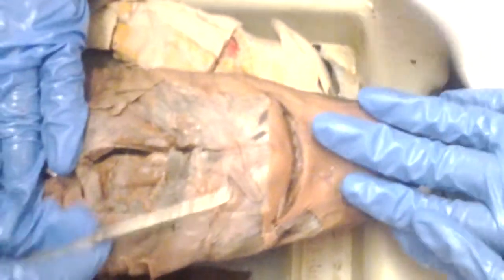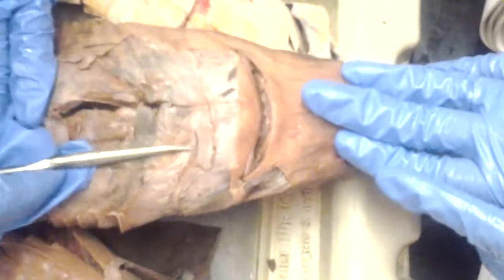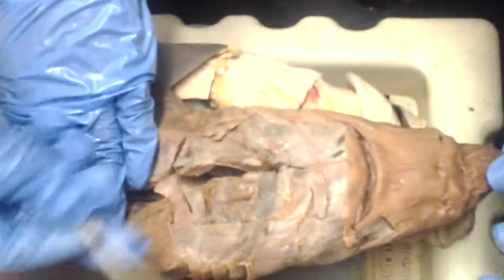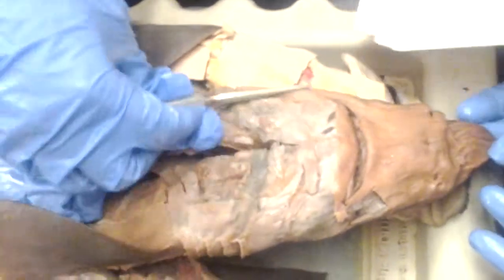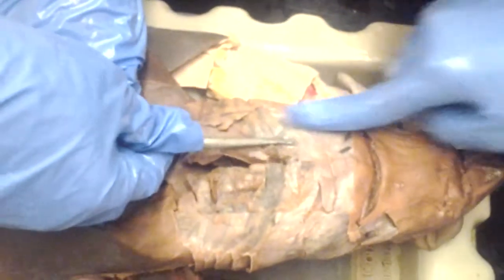Intermandibularis is going to be the outermost layer, the first layer you come to when you dissect. So it connects between... We took it out. Where does it originate? The mid-ventral raphe. And it goes to Meckel's cartilage. Okay. So it's going to go out from both sides. So there's a left and a right.